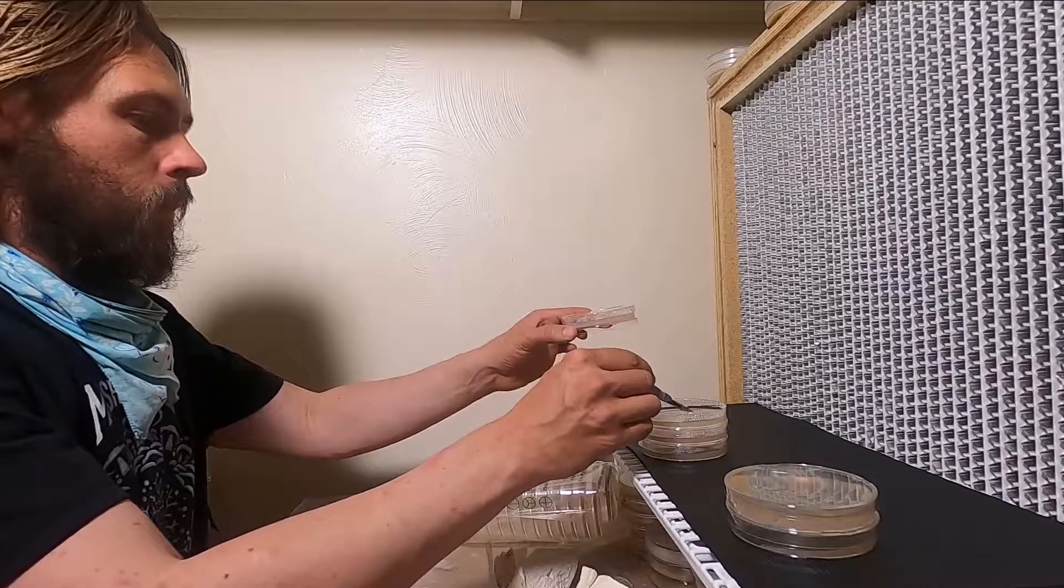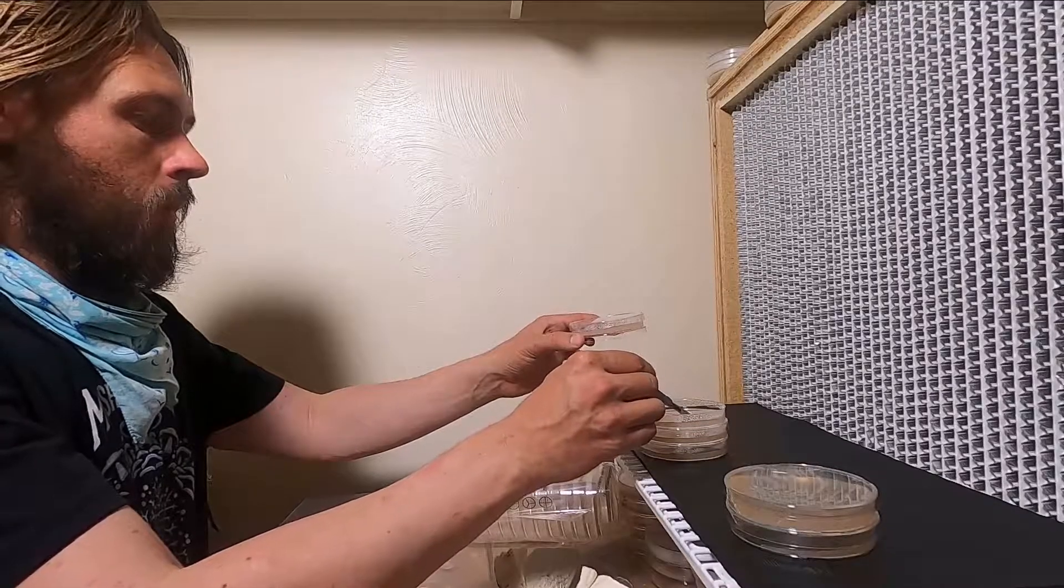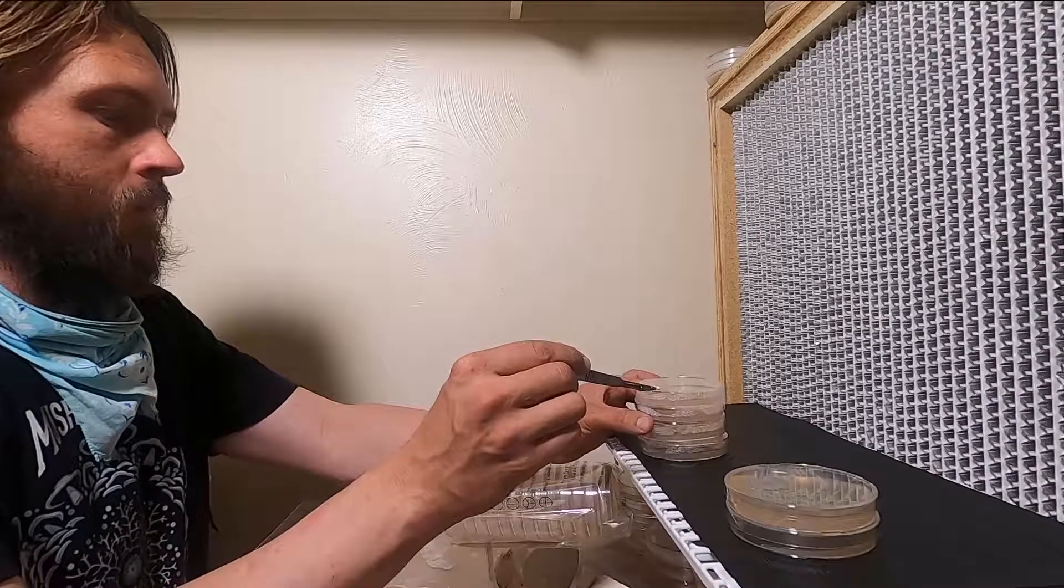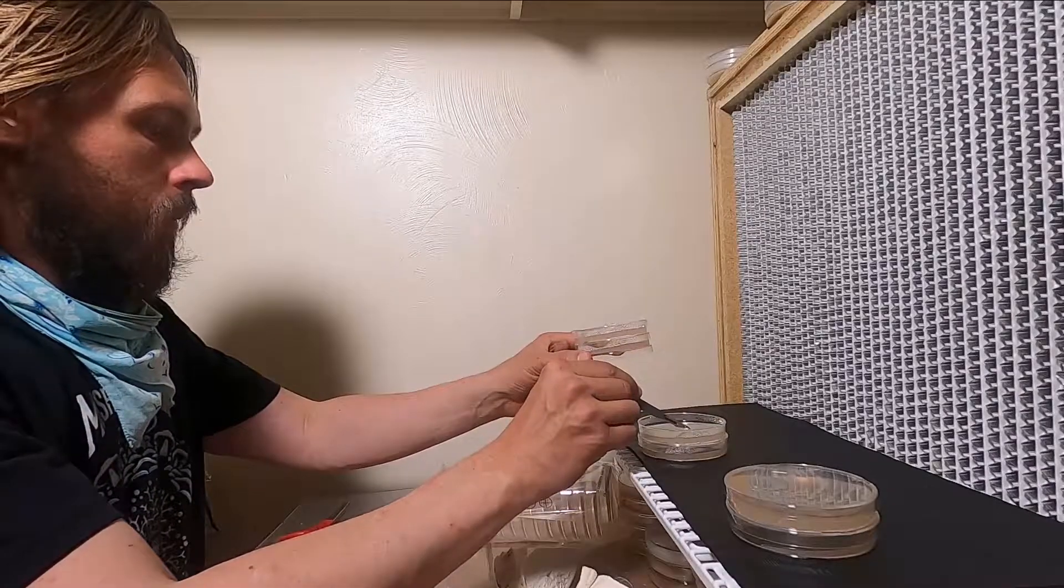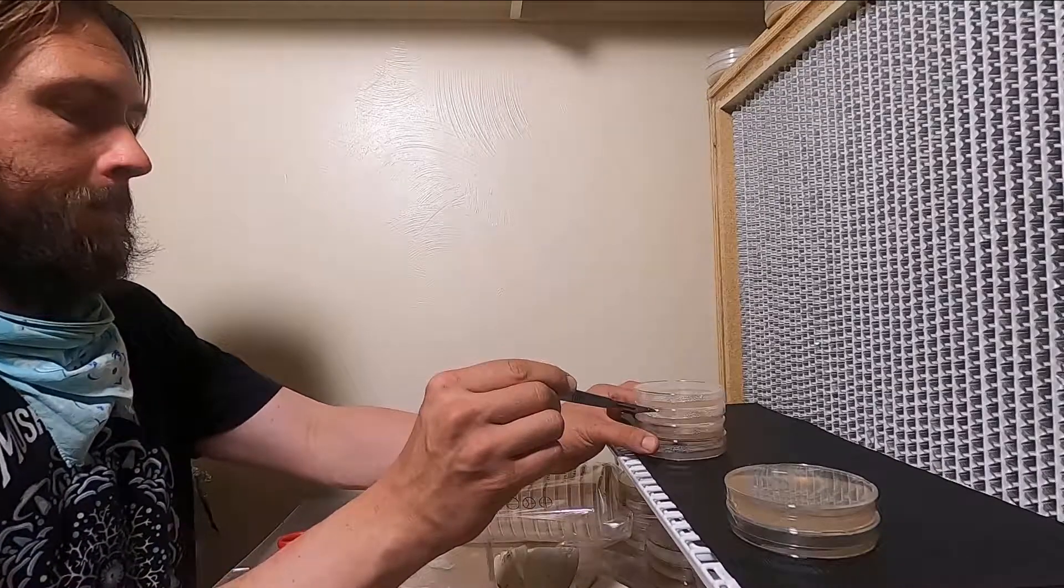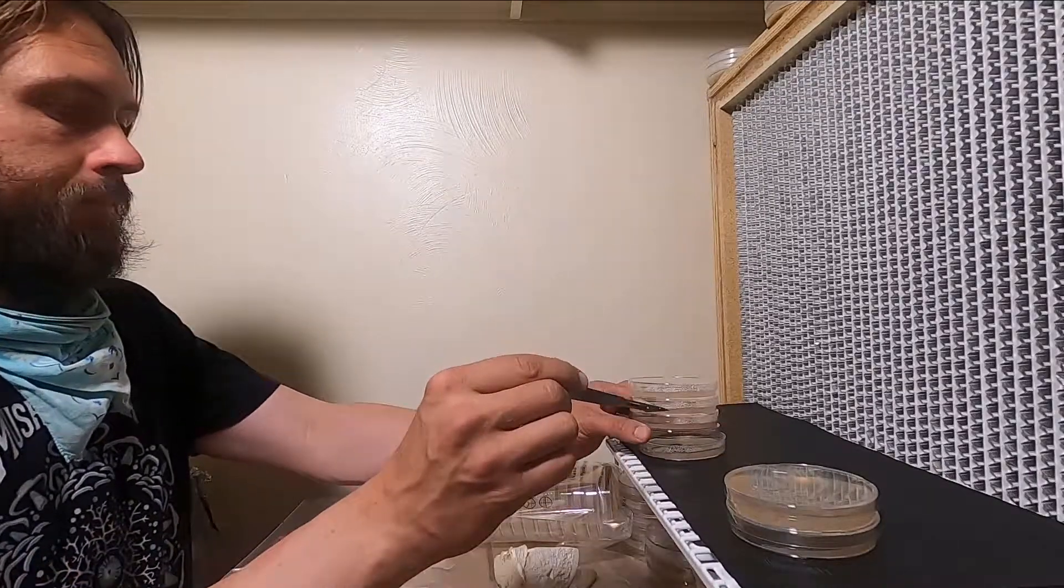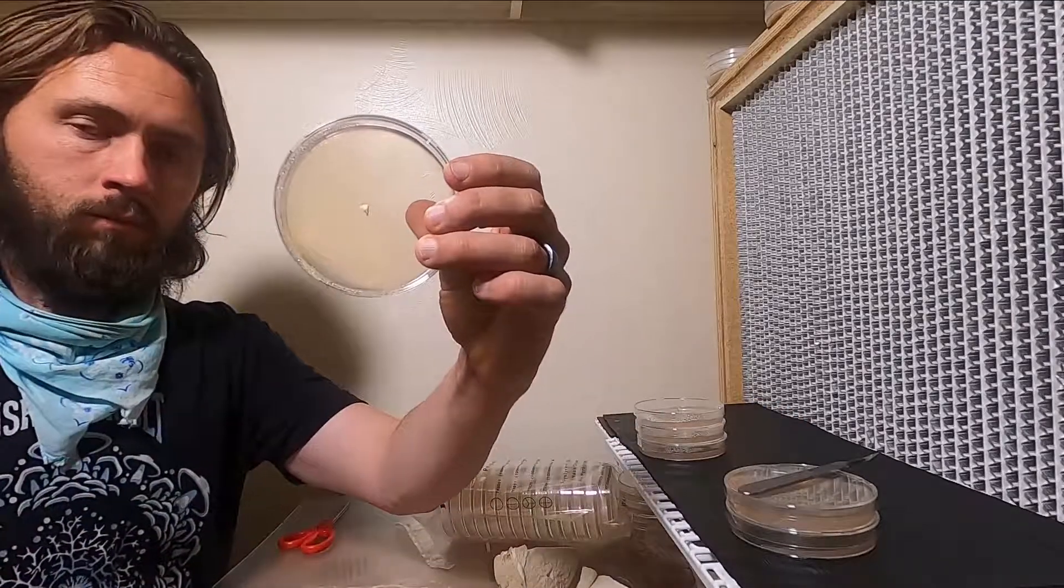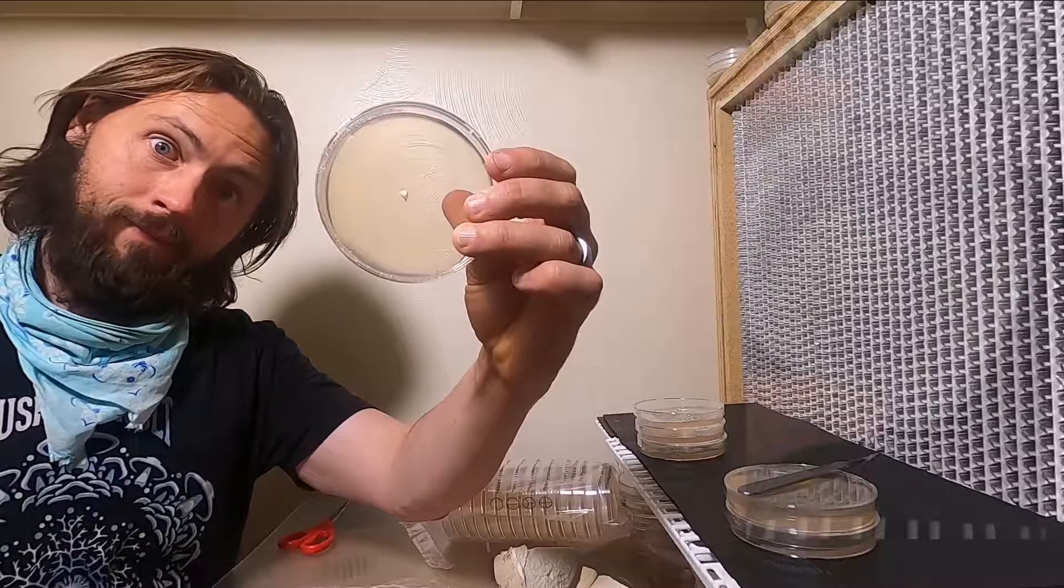I'm moving on to the next one. Cut that in half. And then I'll pick up a piece and move on to the next one. Cut that in half. And move on to the next one. This won't be possible with a lot of mushrooms because they're too dense. So you would just do one transfer for each plate. But here I was able to cut it because it was quite soft.